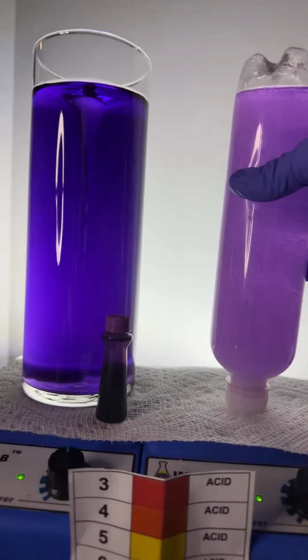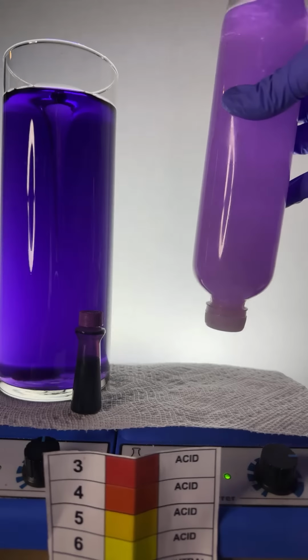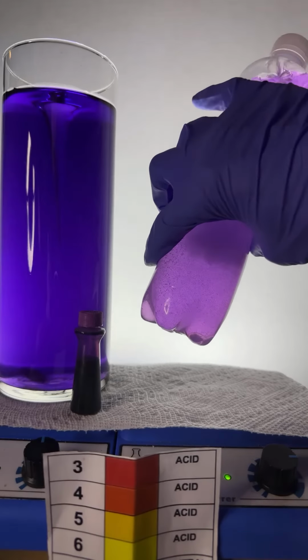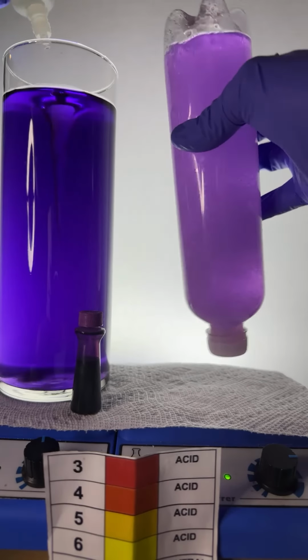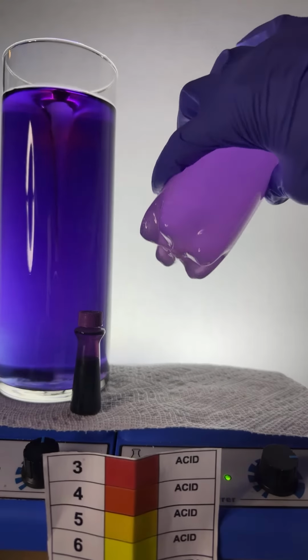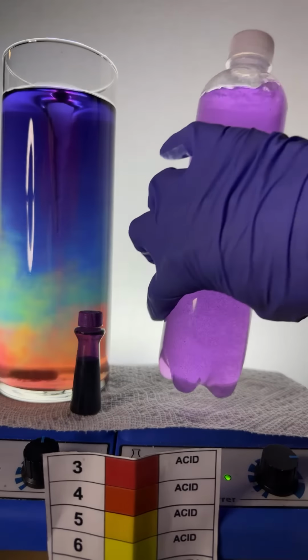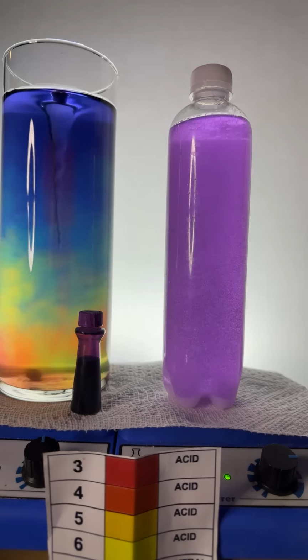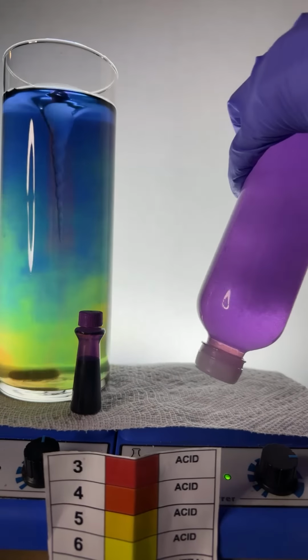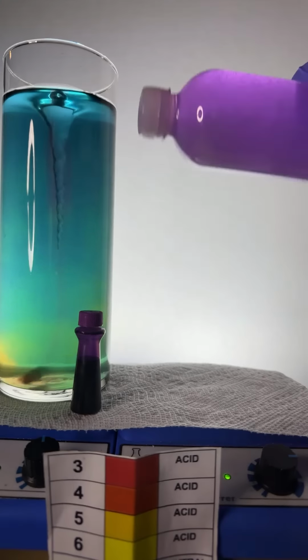And while I'm mixing, I'll start adding some hydrochloric acid over here on the left so we can see some color changes. There we go, a couple drops of hydrochloric acid. For those of you that know what's going on in the chem lab here. Oh, we got a little shine of the rainbow. I'm loving it. The chaos in the bottle.